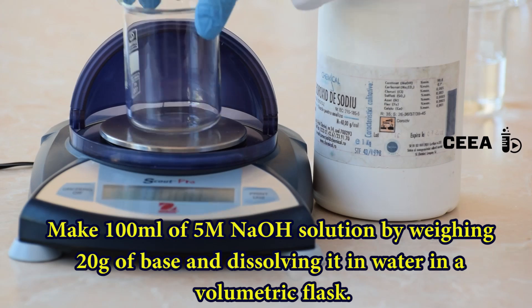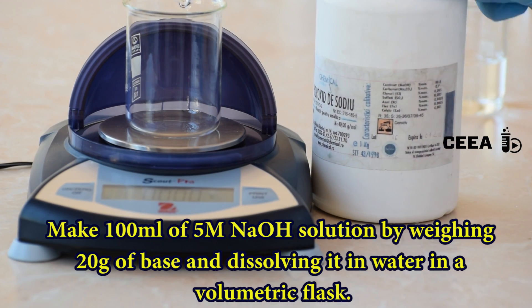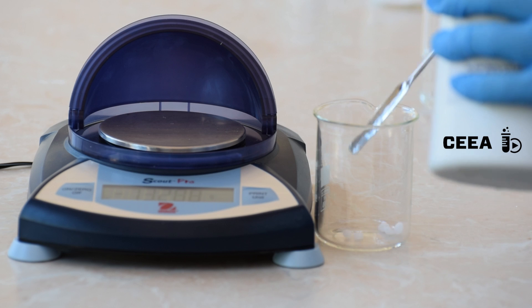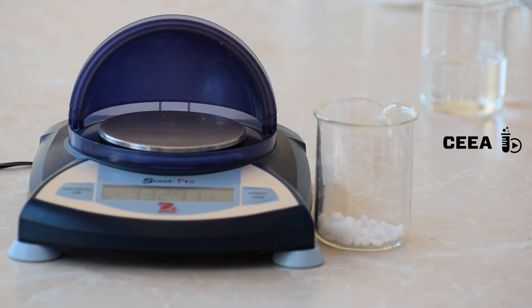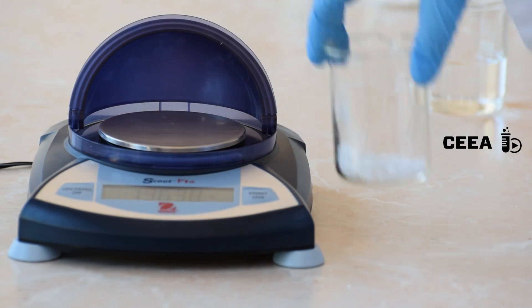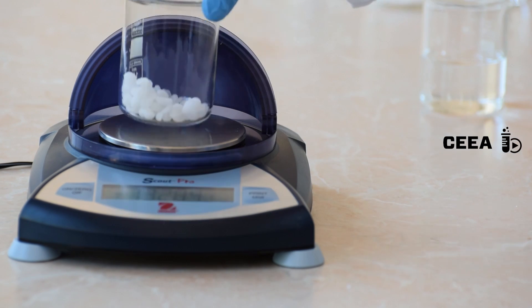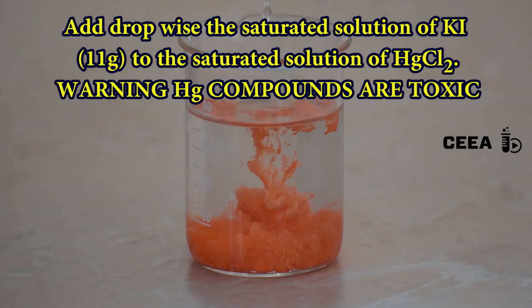The third step is to measure 20 grams of sodium hydroxide in order to make 100 milliliters of a 5 molar solution. Then add the iodide dropwise to the mercury solution.